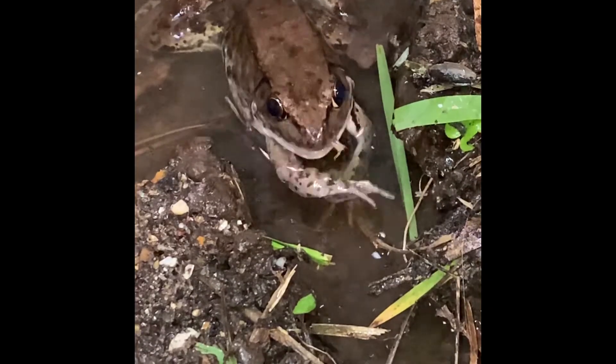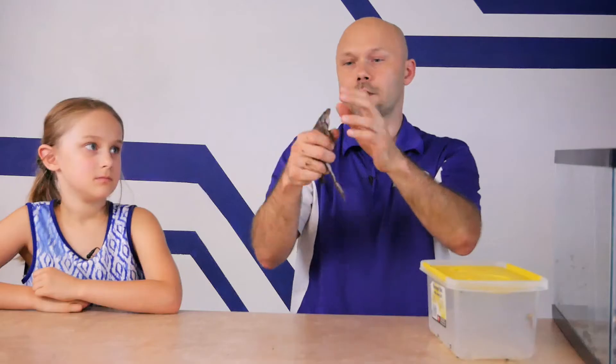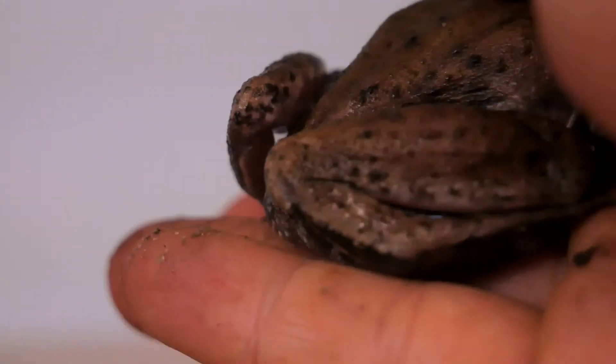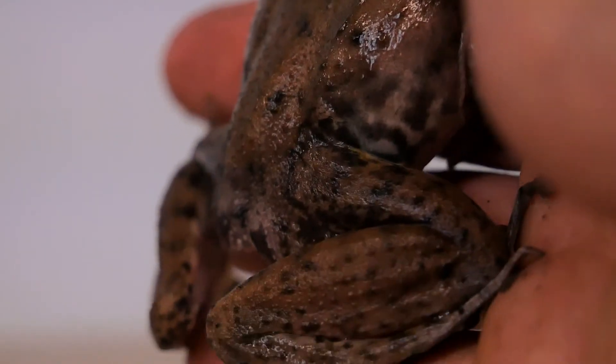If you touch his skin, tell me what you feel — slimy, kind of wet. He lives more in the water than the toad does. They actually like living in the water a lot more. They have really strong legs — he can actually push. These things are very strong, they're hard to hold, and they can jump really far. They can actually jump 12 to 20 times their body length. They have strong backs to swim, shorter legs in front to absorb impact when they land, and their back legs give them the strength to swim.